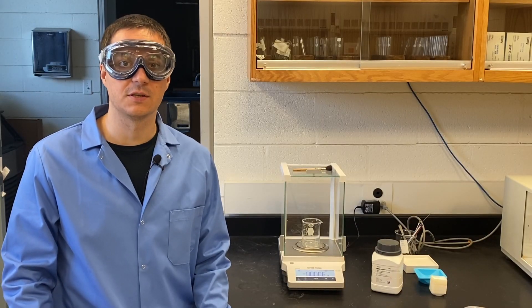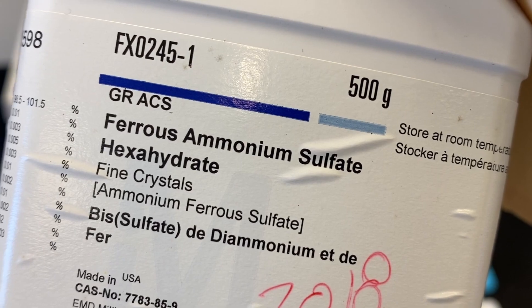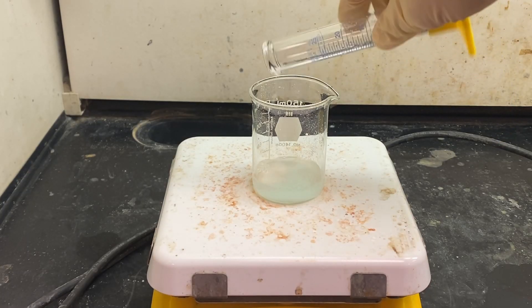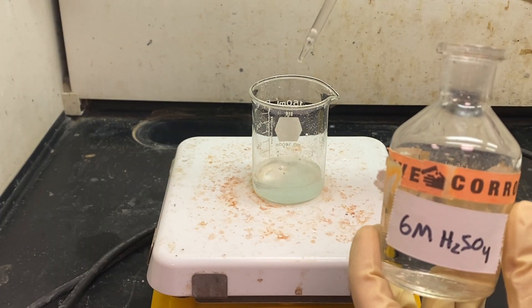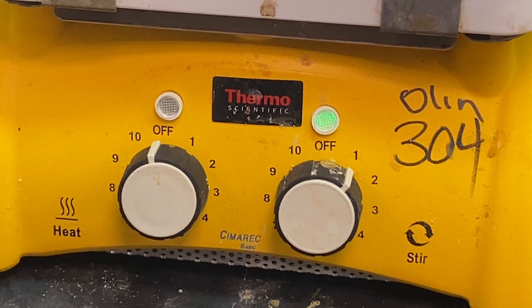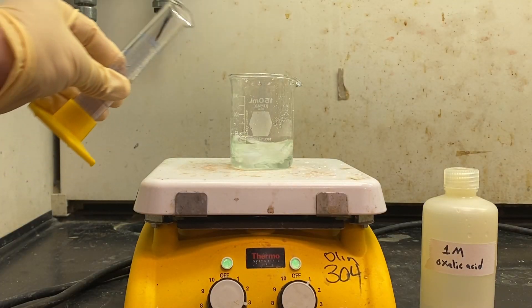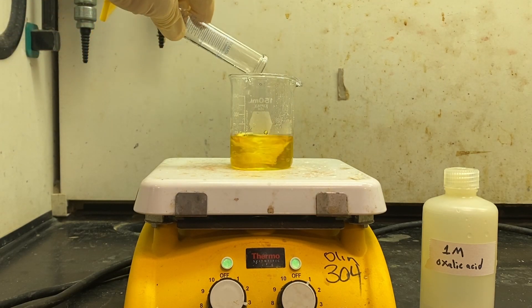First, five grams of the starting material, ferrous ammonium sulfate hexahydrate, are weighed out. The chemical is dissolved in some water and a few drops of 6-molar sulfuric acid are added. The solution is placed on a hot plate with a magnetic stirrer to dissolve, then 14 milliliters of 1-molar oxalic acid are added.